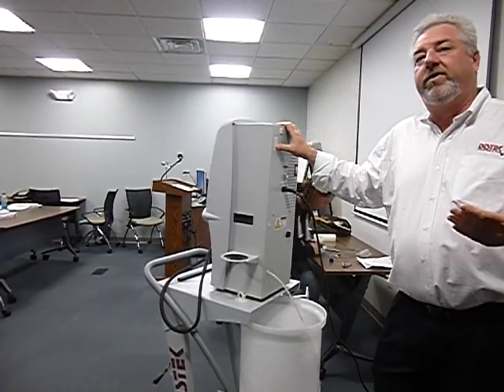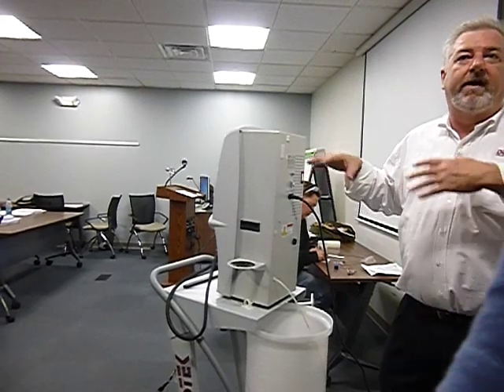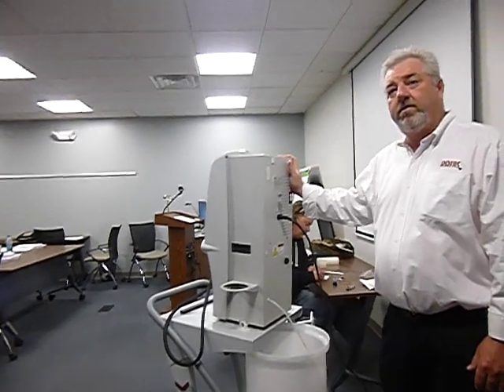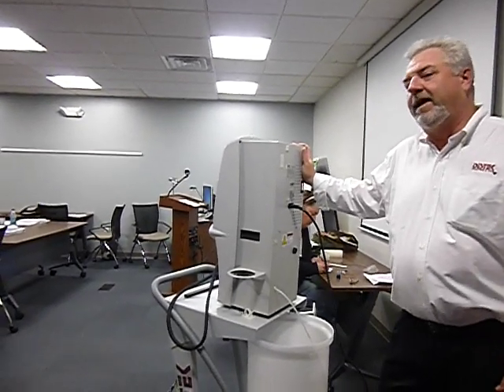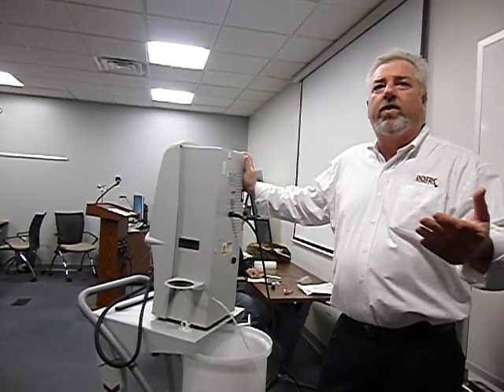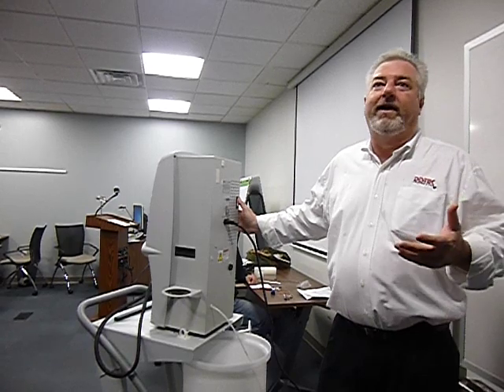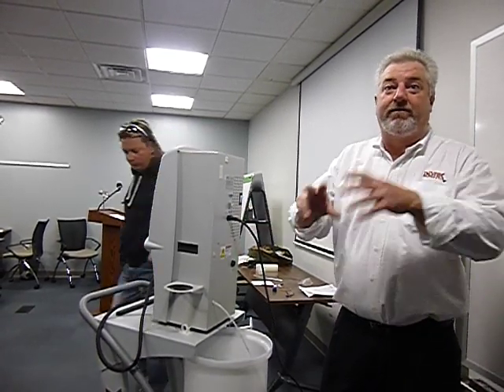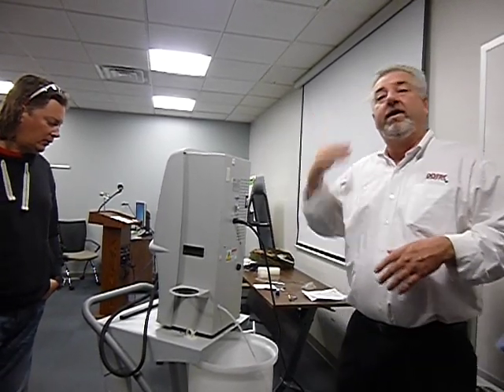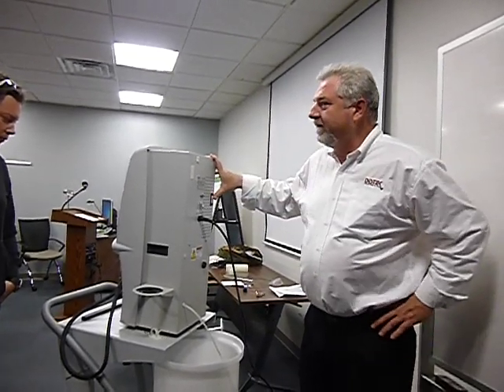The only thing I use it for is to reset the original factory settings for the volume. If you push 3 buttons at the same time, it will delete the firmware on the old ones. There's a new firmware upgrade, the latest one, I think it's .106, don't quote me on that, where you can't delete it anymore. The engineers didn't think anybody would go around and push 3 buttons to delete it. We found that issue too, so that's why it's changed. The customers are idiots.